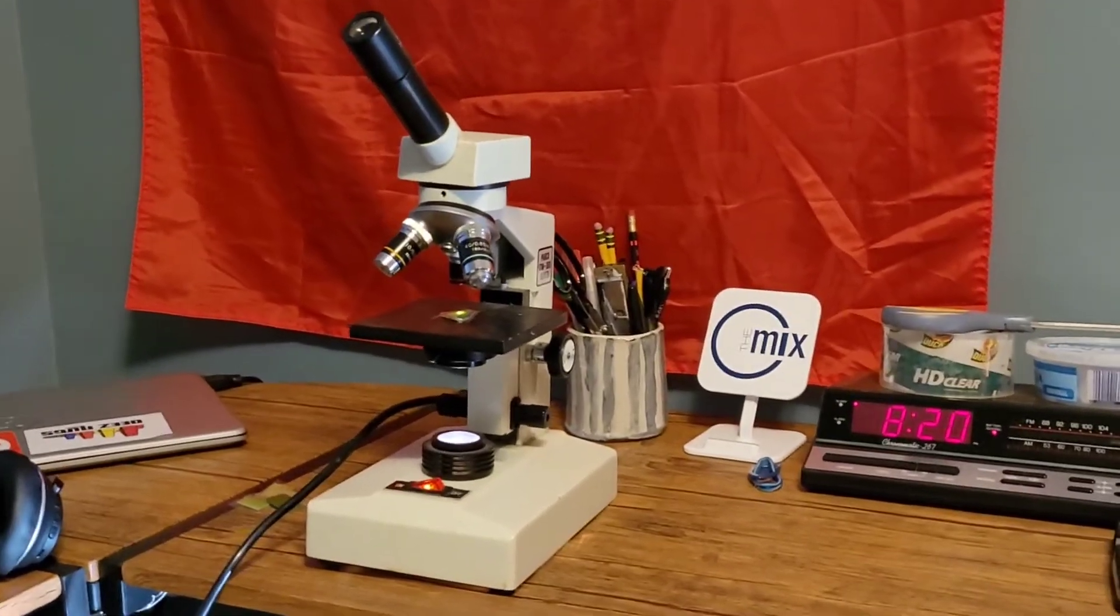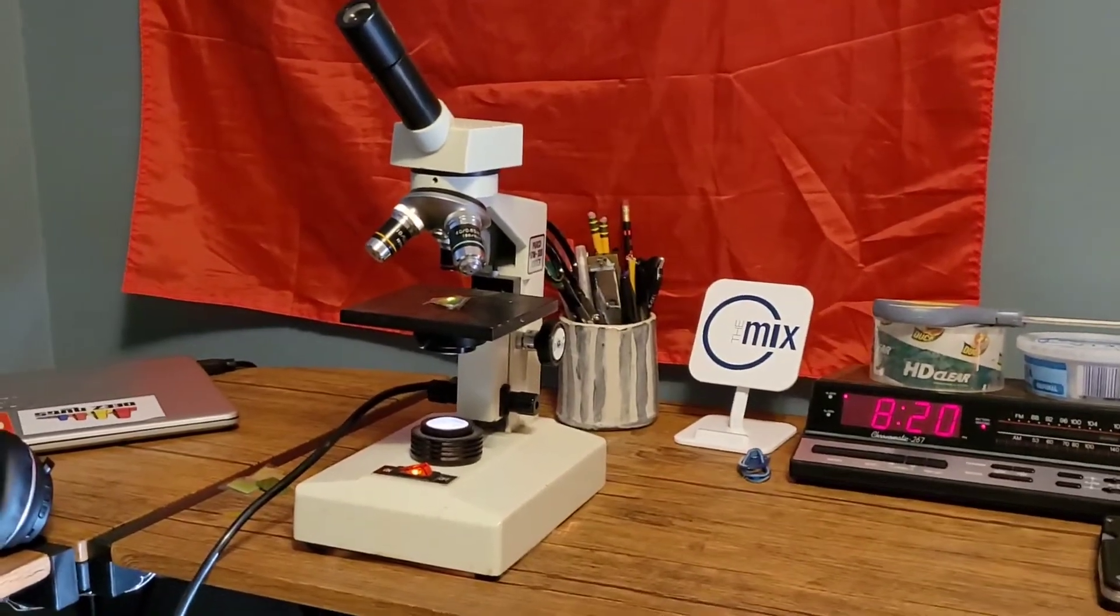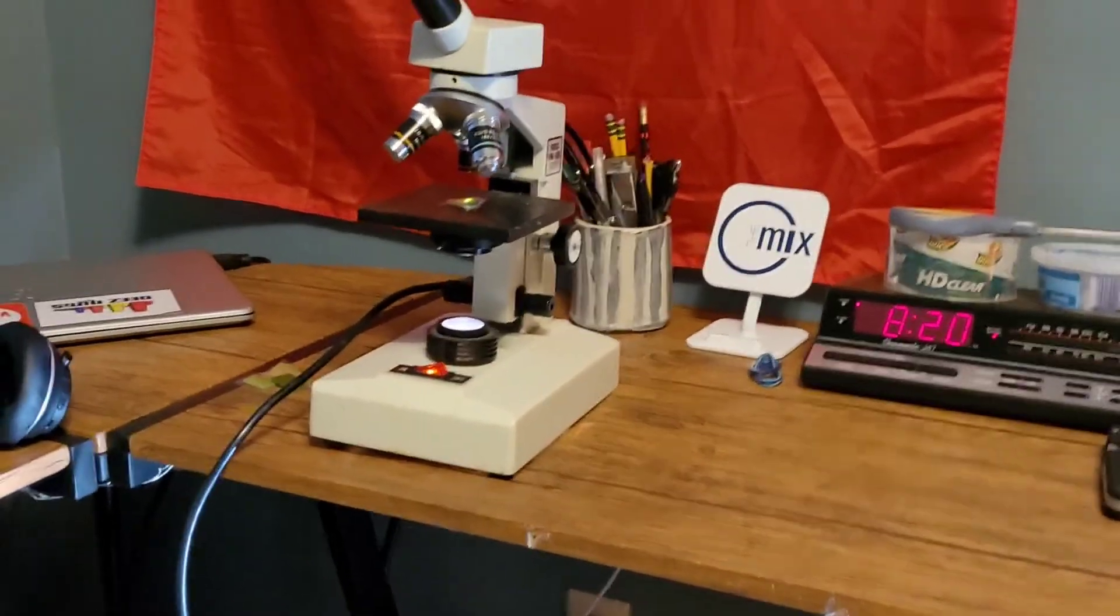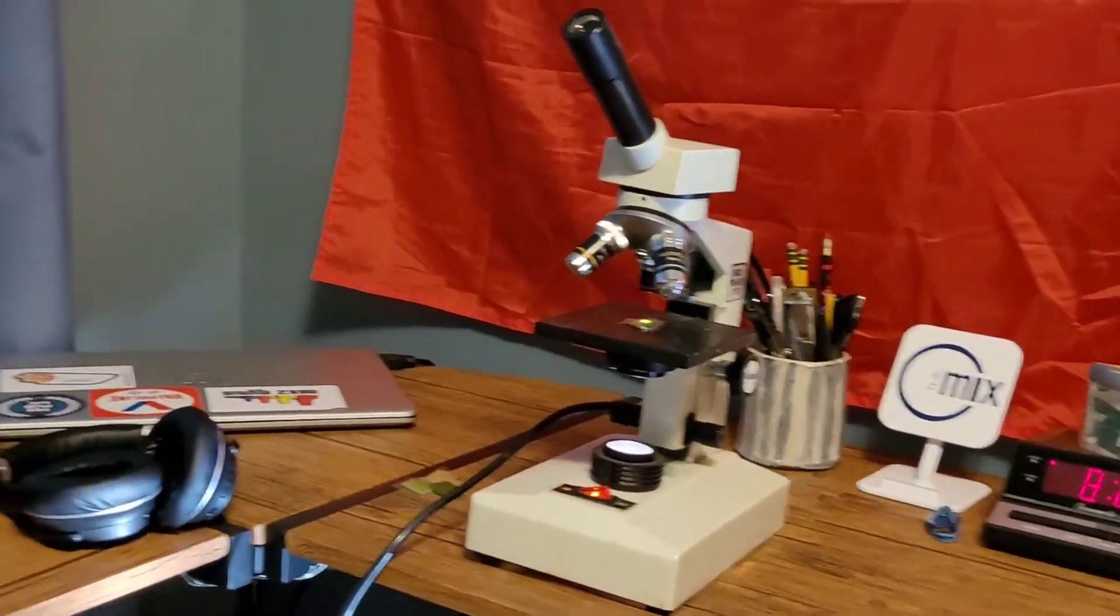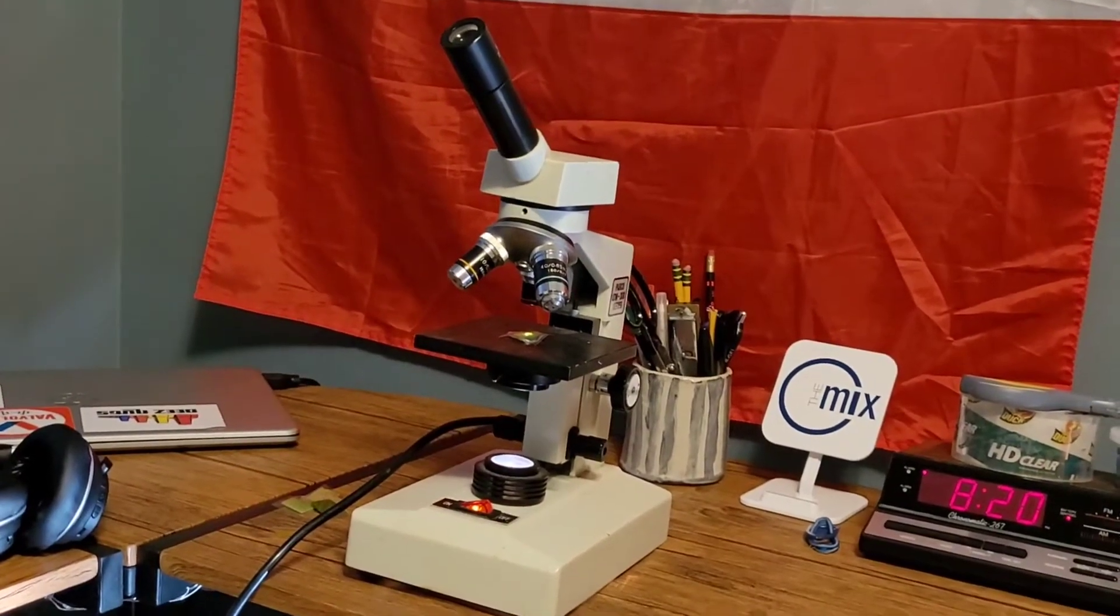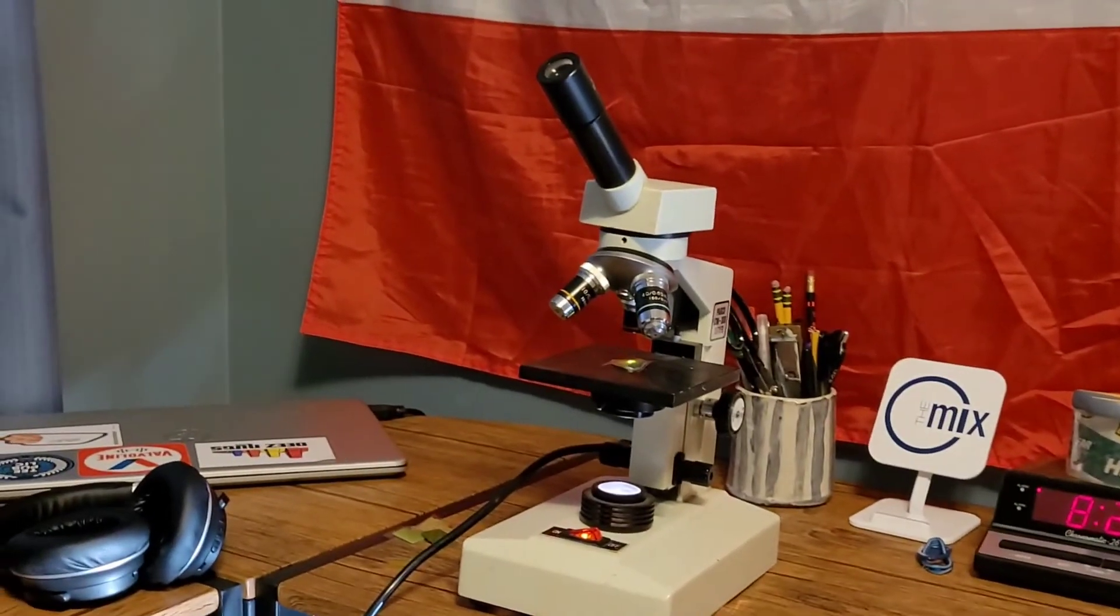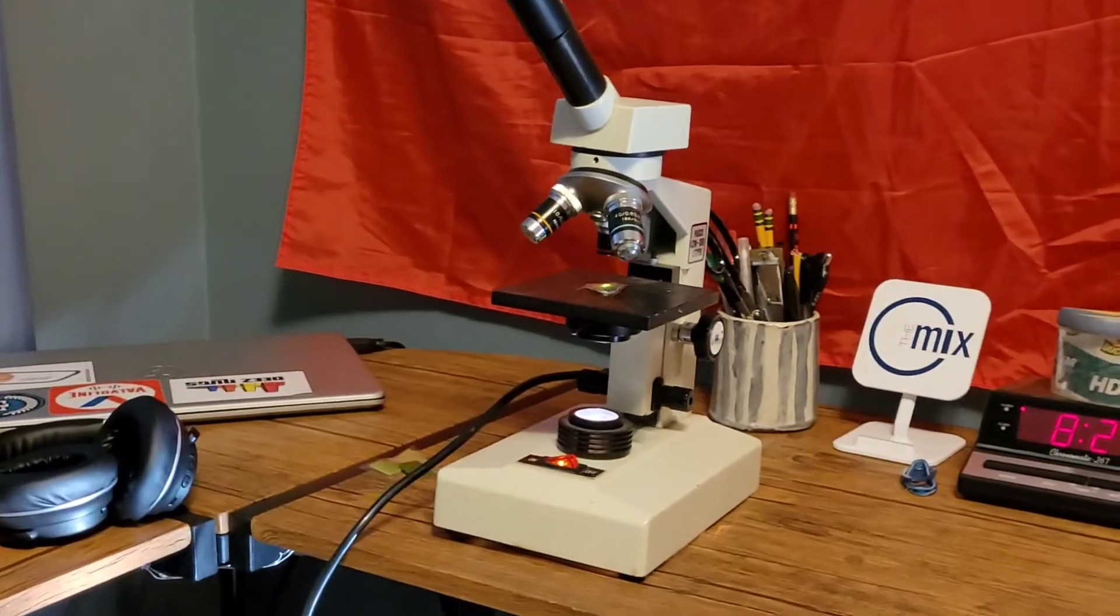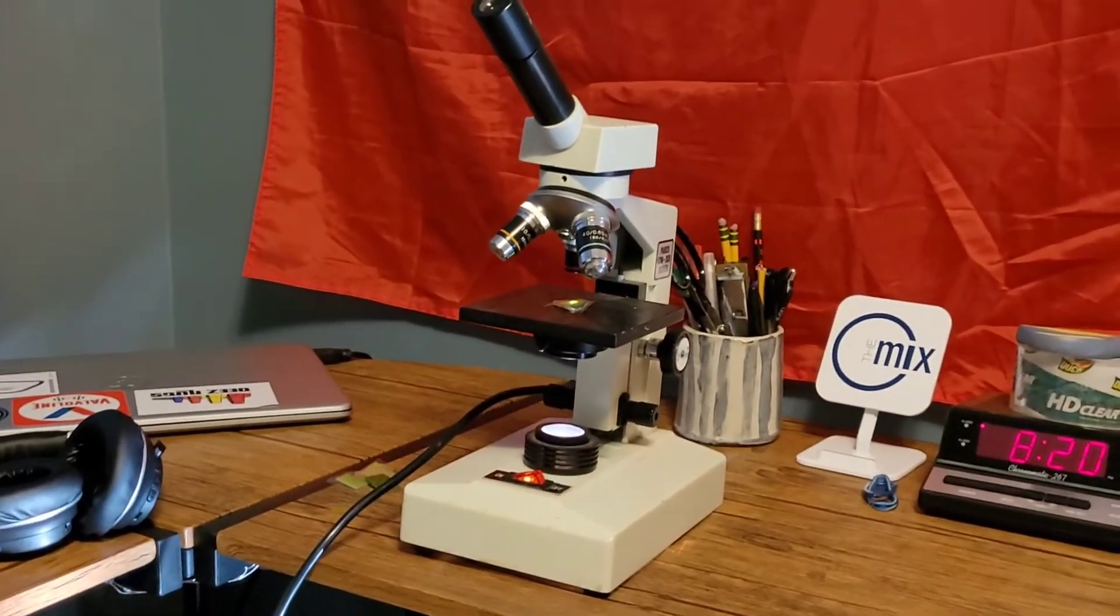Today we're going to be using a microscope to look at leaves. If you want to know more about the microscope, just say something in the comments and I'll make a video on it, but I'm going to be doing stuff on plants today, on plant leaves.